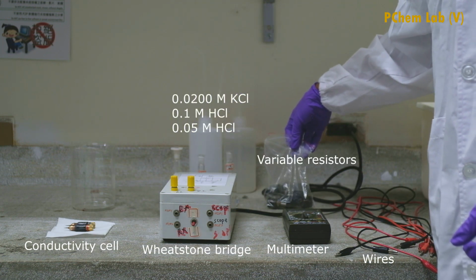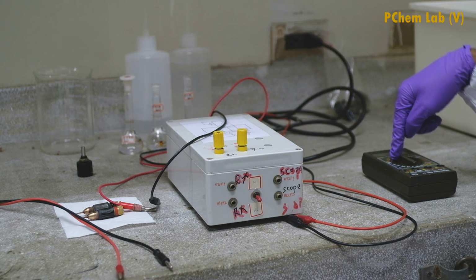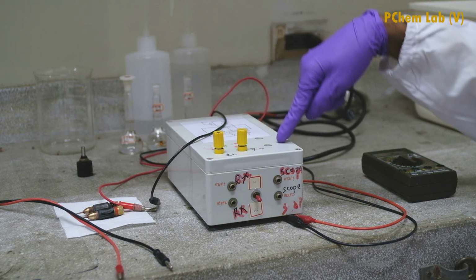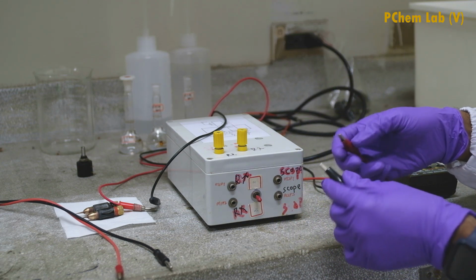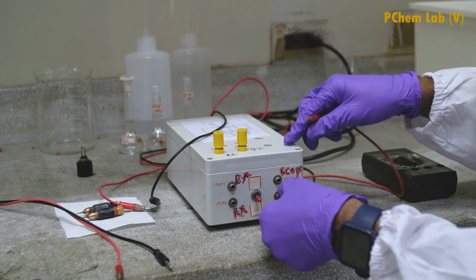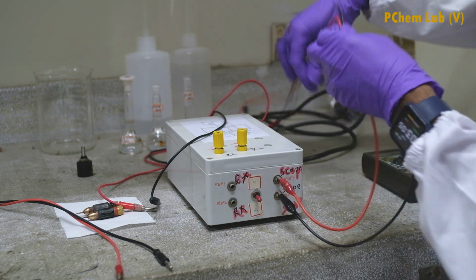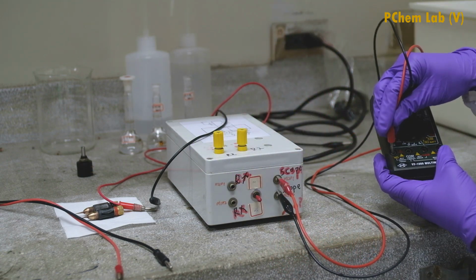Now I am going to connect the Wheatstone bridge to the multimeter, conductivity cell, and the variable resistor. First I will connect the Wheatstone bridge to the multimeter. For that you need the connecting wires. First connect the wire for this pin. And connect the two wires like this.